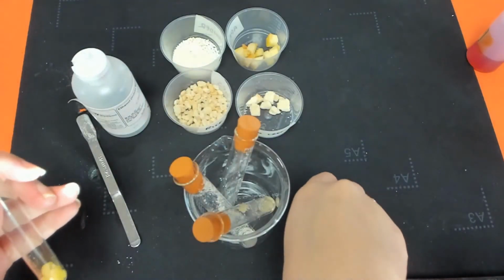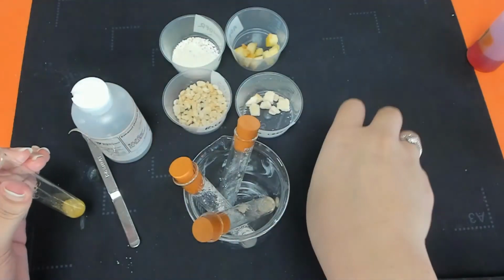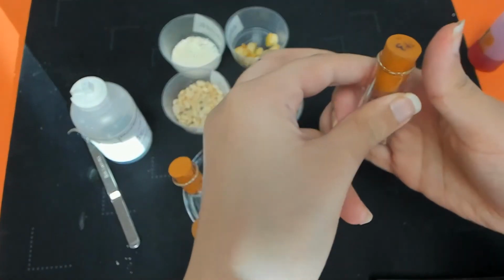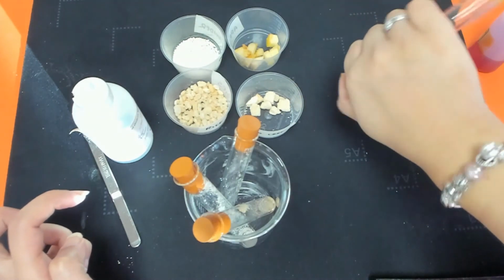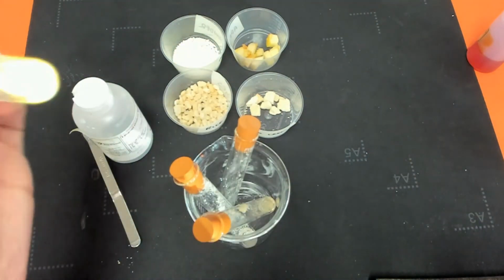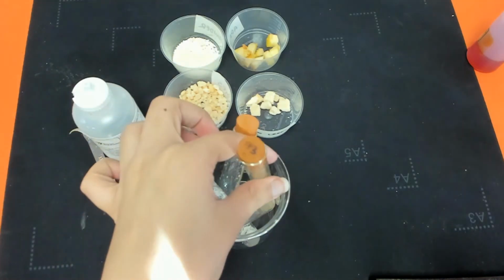Finally, let's have a go with our apples. Sometimes you can actually predict what's going to happen just because certain foods will contain a lot of fats or a lot of sugars or a lot of proteins. So you can often predict the results. Yeah, as expected, our apples are non-fatty, so they don't have that cloudy kind of liquid. So therefore that's a negative test.